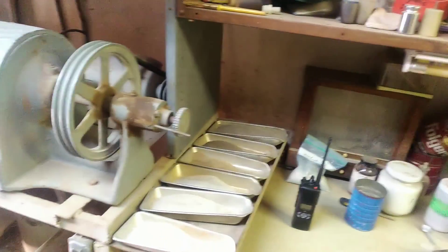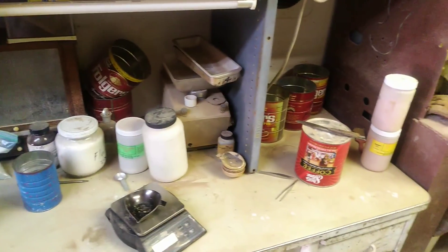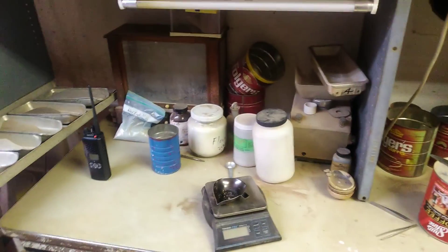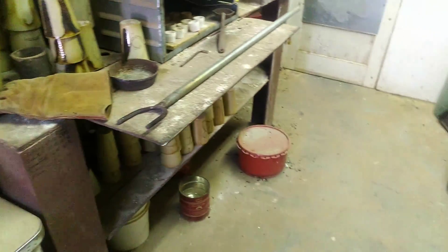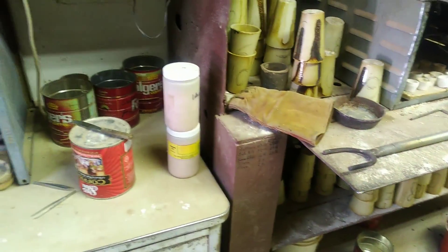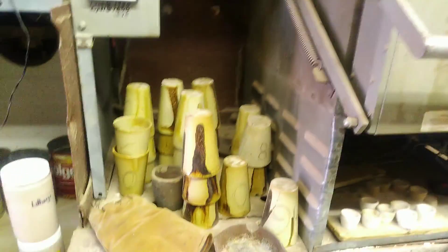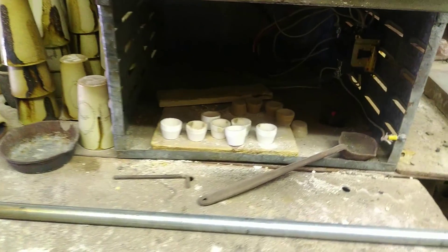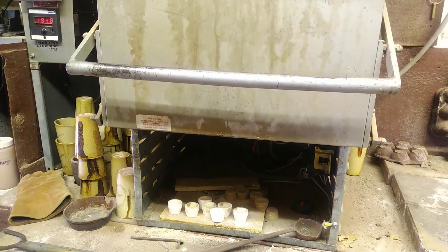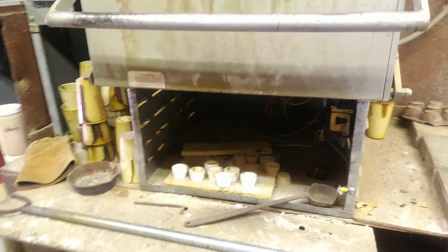Apologies for missing the fine sample prep where you're adding other reagents. Bone ash is one. We've also got fluorospar and nitrate. Down in that red tin is lead litharge, or lead monoxide. Here we've got our furnace running at about 1,950 degrees, with crucibles and bone ash cupels. We're running the sample fusion in the crucibles and then eventually we'll get to the cupellation stage.